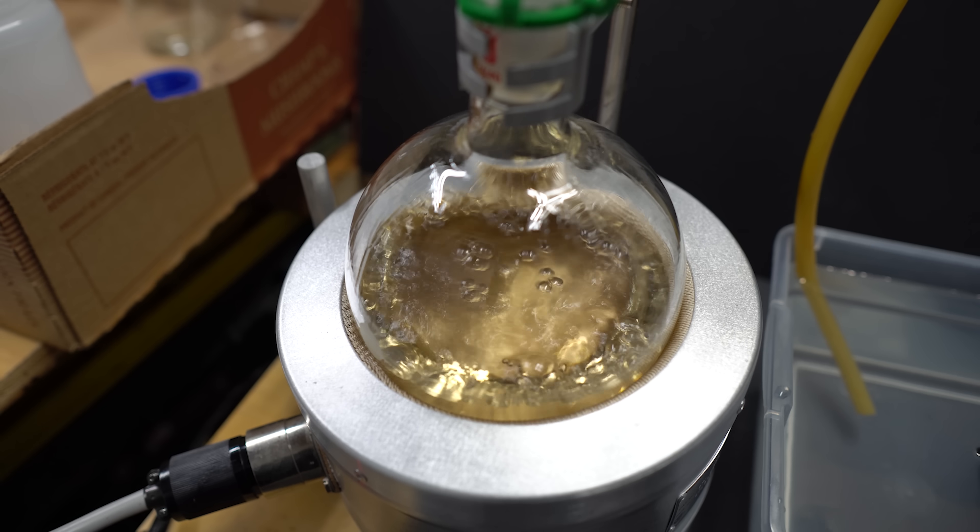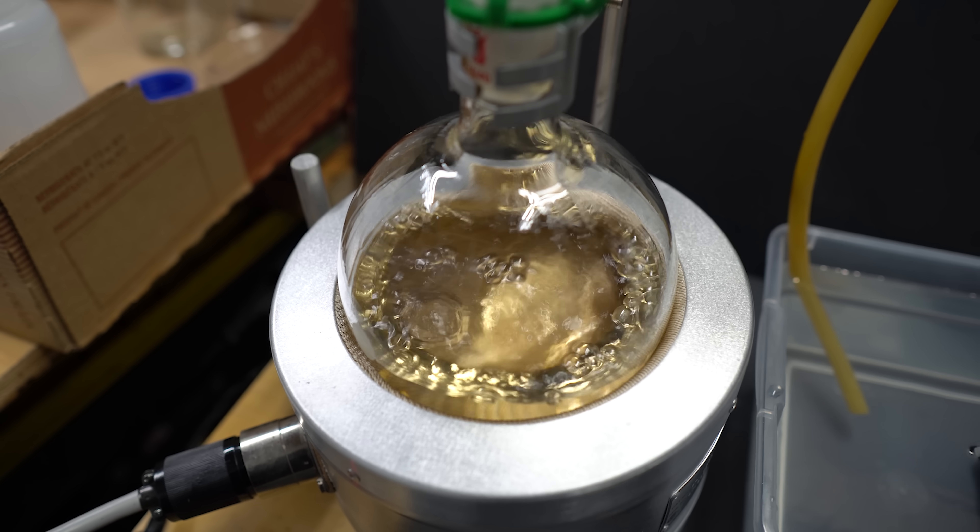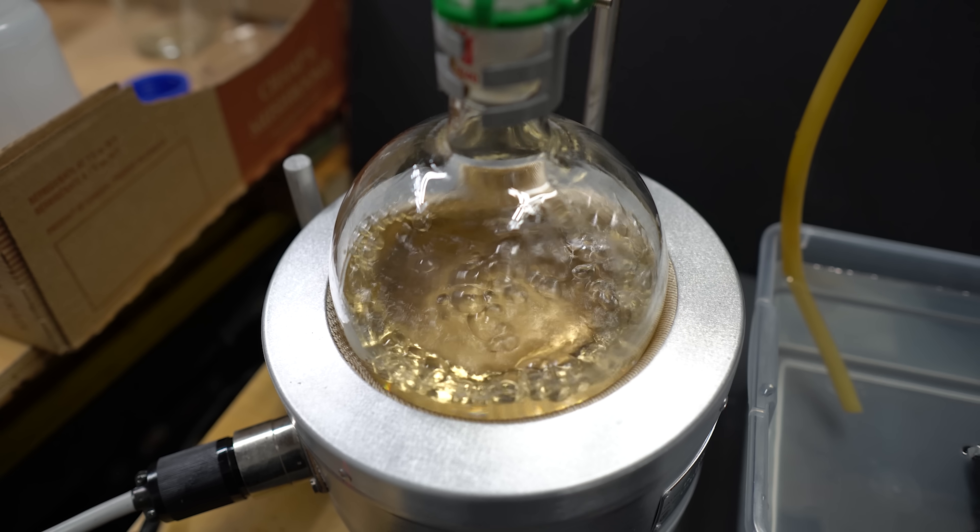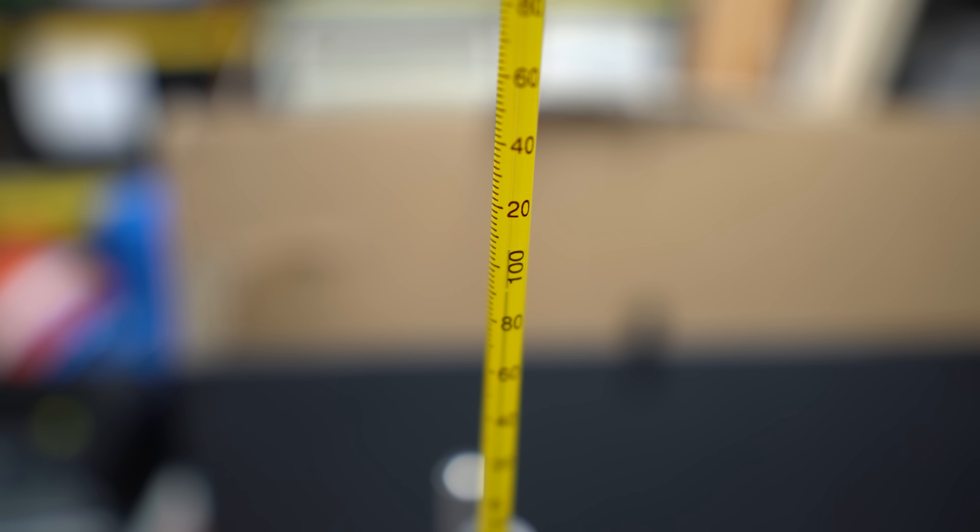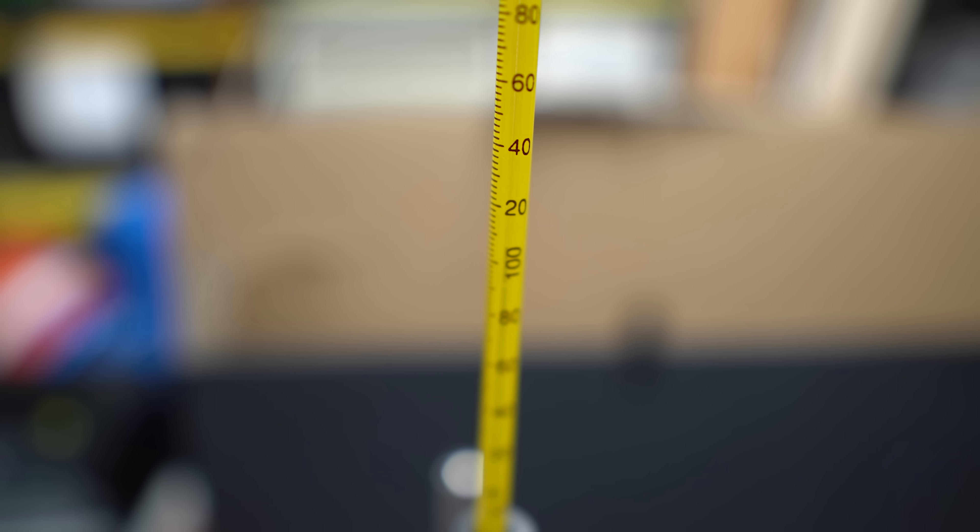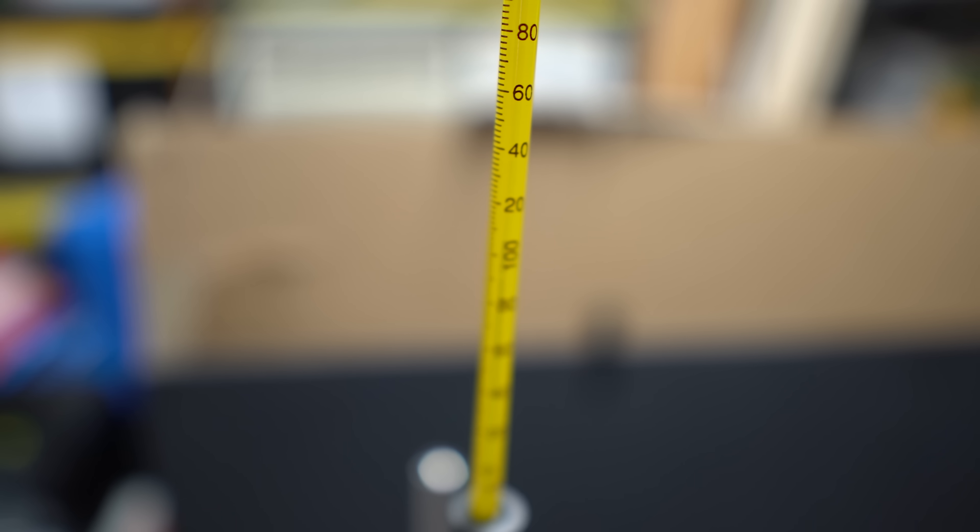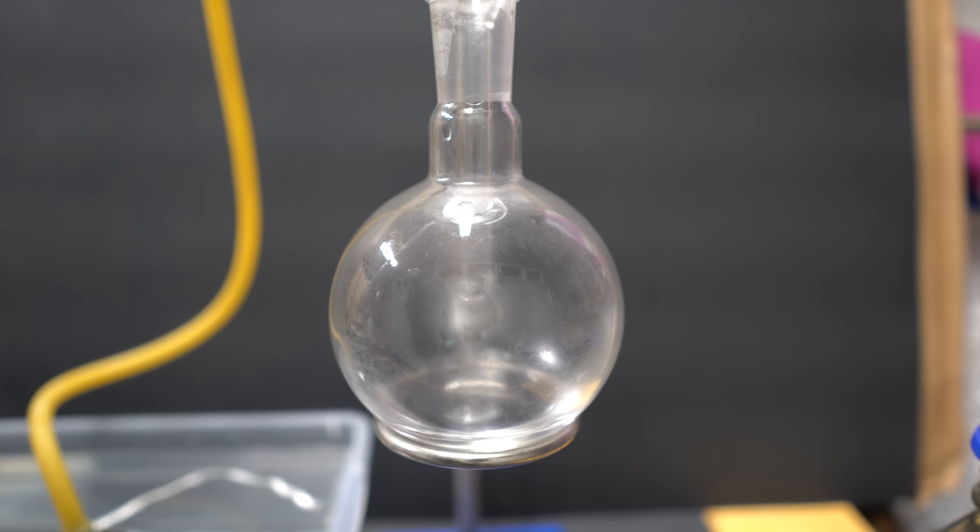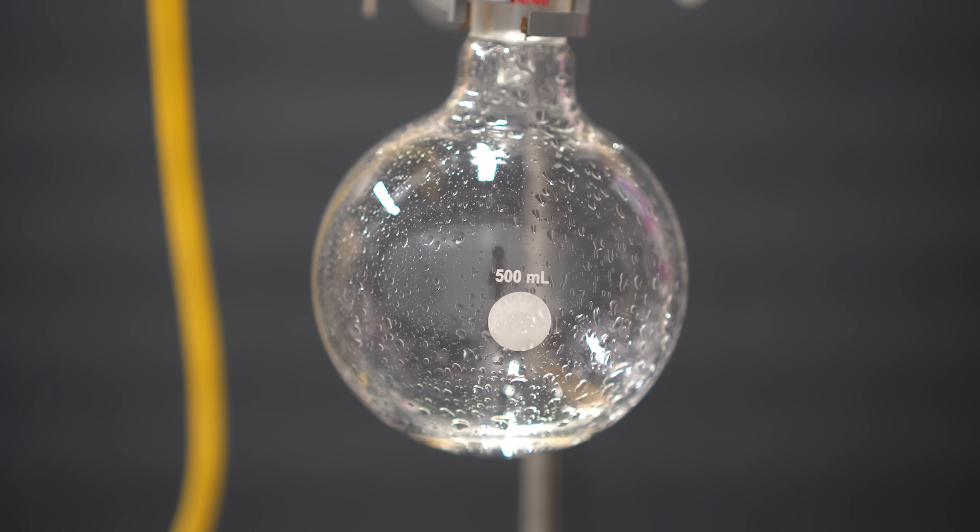It did take quite some time for everything to boil down, and eventually hit the 124 degrees Celsius mark. You can see in this next clip that it remained at about 106 to 110 degrees Celsius for quite some time before it actually hit the 124 degrees Celsius mark. When the temperature finally reached 124 degrees Celsius, I made sure to be very careful, and I switched out the flask for the new receiving flask.